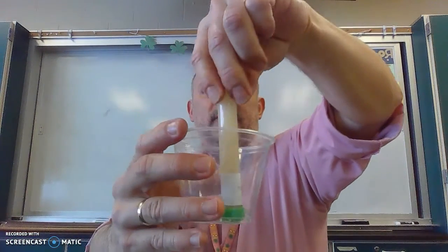And I'm going to put the lid on it. And this lid has a little hole in it so that some of that yeast solution, when it's screwed on tight, is pushing out of the hole at the top. See that little bubble there? And what I'm going to do is put my finger over the hole, and invert that tube into a cup. I'm going to do the same for the no sugar yeast solution.